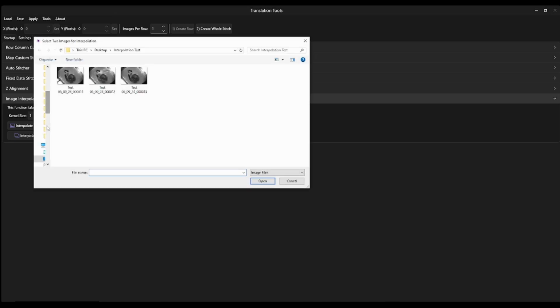So now I'm in this file dialog. We can see I have 3 images in this folder. So what I've done is taken these 3 images from the original stack and I've placed them in their own separate folder. So I've taken my problem image, the image that I want to replace with the interpolated image, and what I'm going to do is just click delete. Now I'm left with 11 and 13, which leaves me a gap in between the 2 images.